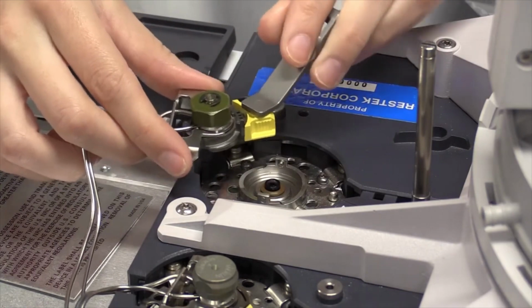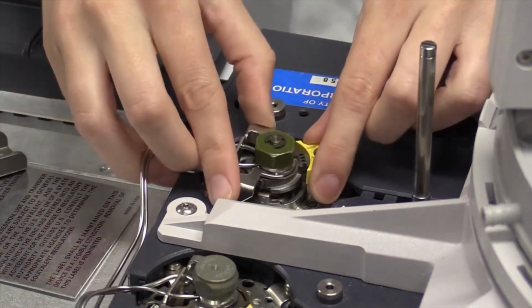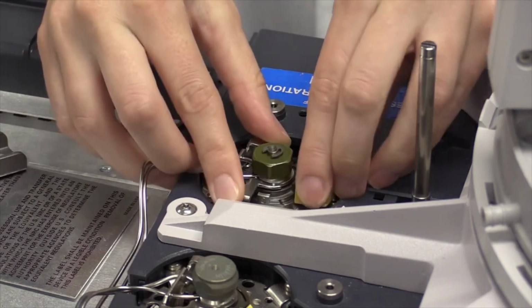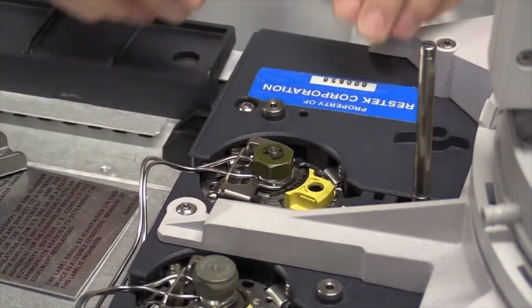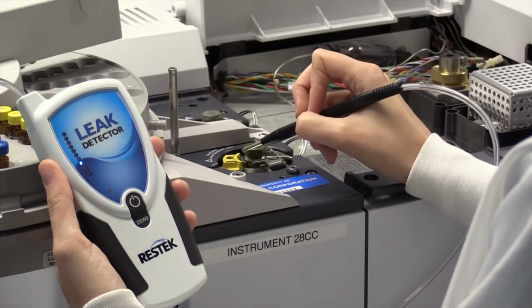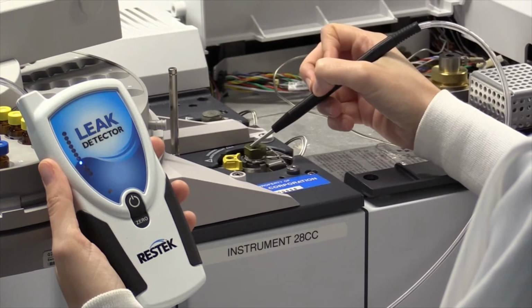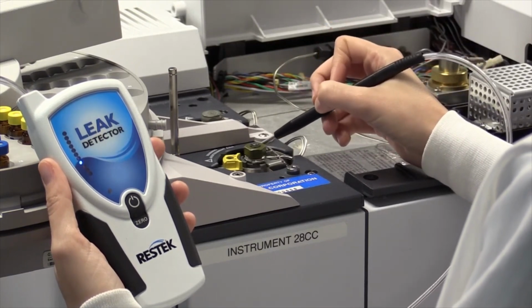Incorrectly tightening the septum nut or injection port weldment after changing the septum and liner can lead to leaks. To fix a leak here, try loosening and correctly retightening the nut or weldment. Frequently moving the injection port weldment can crack the welding around gas lines. A leak can indicate that cracks have developed and that the weldment should be replaced.